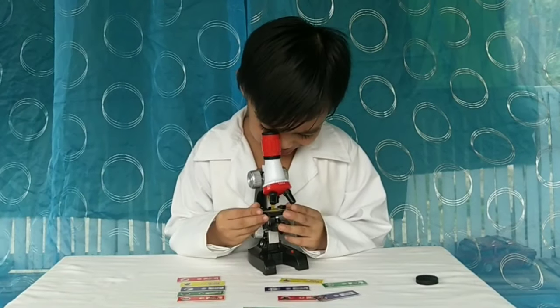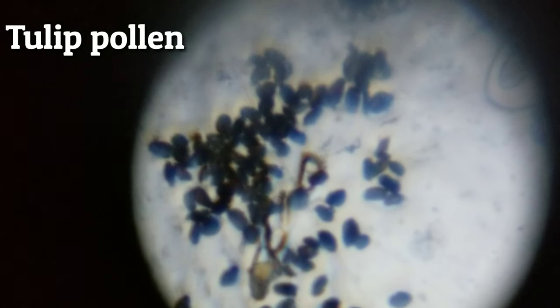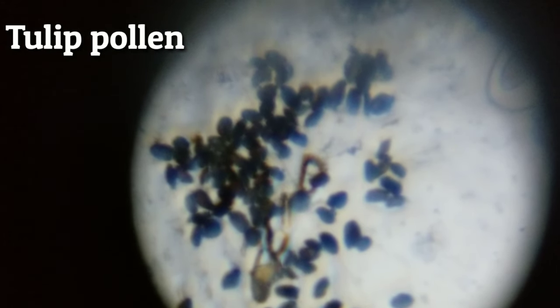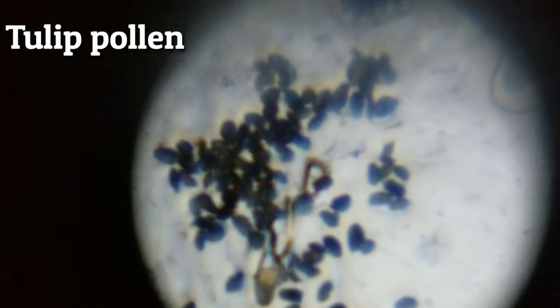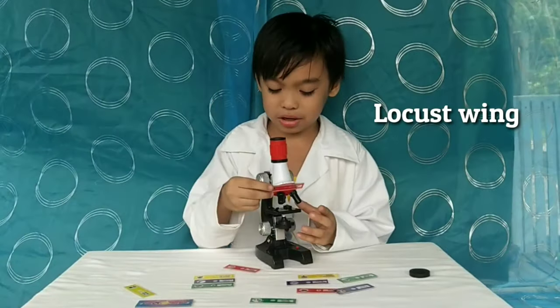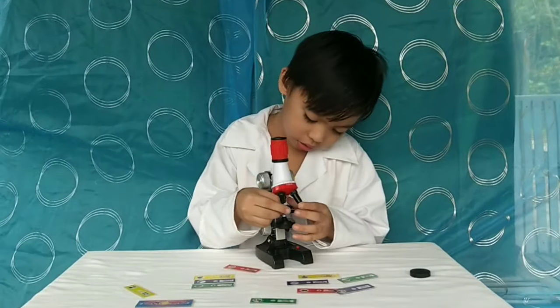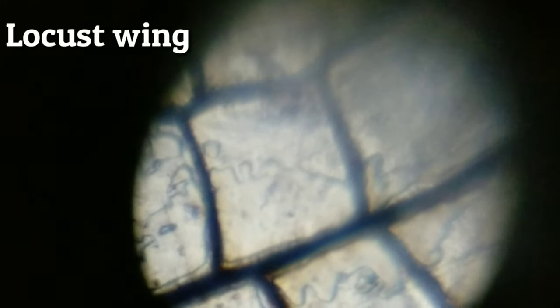Tulip pollen — it looks like tiny seeds. Next one is locust wing. The wing has many square shapes. Interesting!